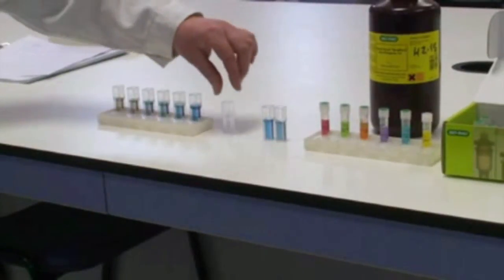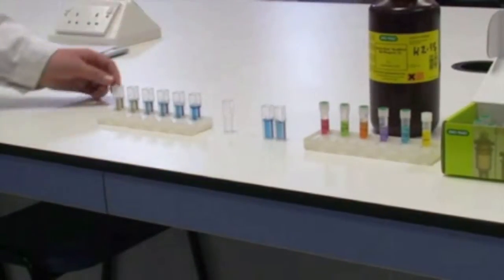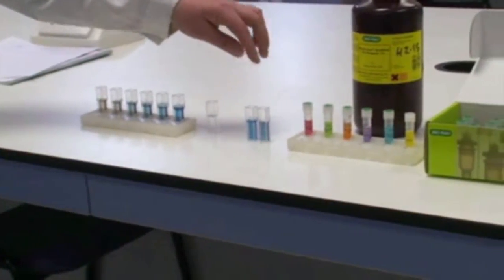Also, you will need a blank cuvette with just water to zero your spectrophotometer. And here you have your unknown samples.